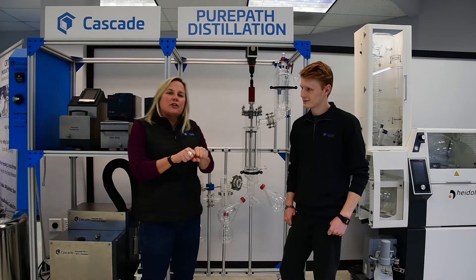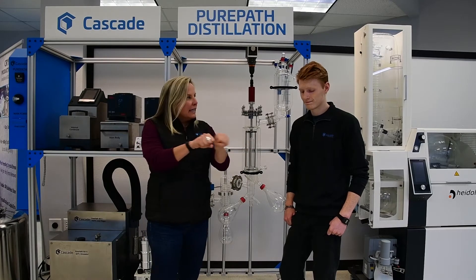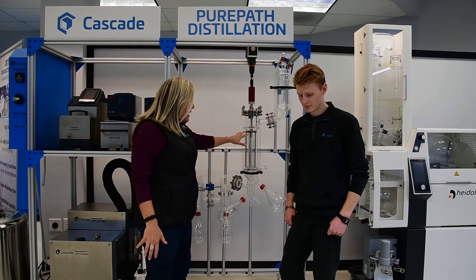With lesser glass, you'll see a lot of people take a big old hunk of vacuum grease to get those connections to achieve that kind of vacuum integrity. But with the Asahi glass, you don't need to put a big old chunk of vacuum grease in there.